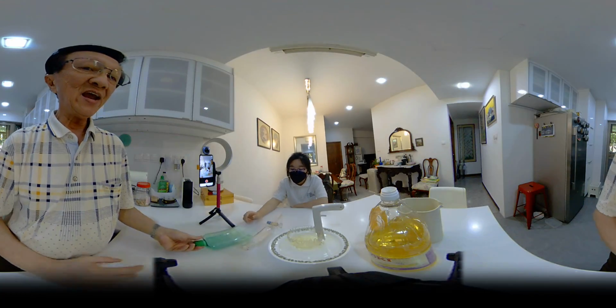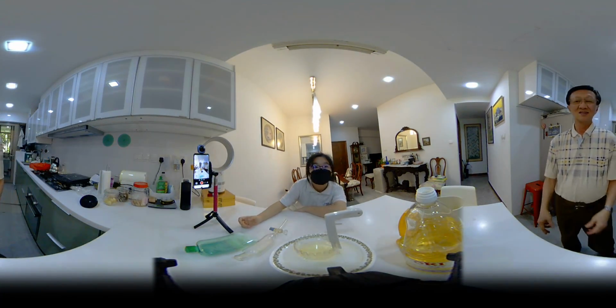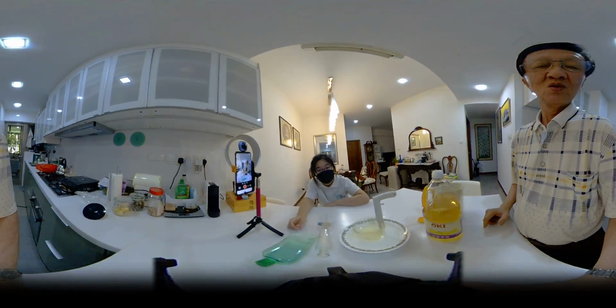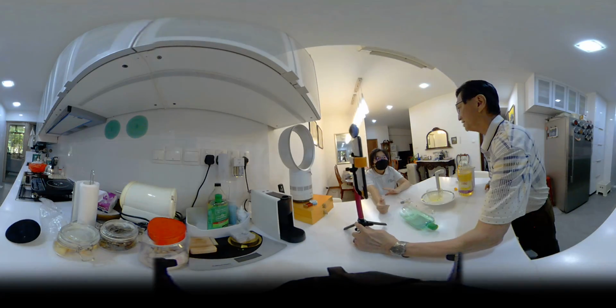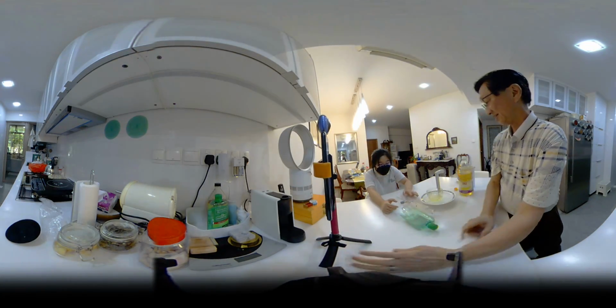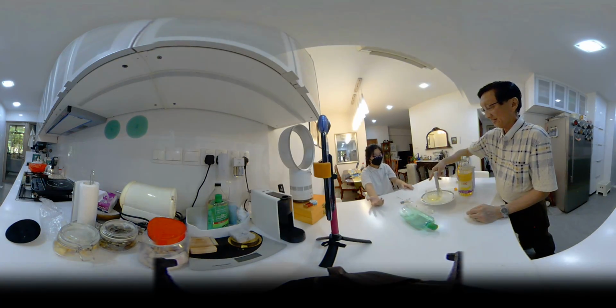Okay. So we have got this. Now we got two directions of this with the same commentary. I think this one has stopped, right? Yeah, stop. They stopped together, I think. Okay. No, not sure, they didn't stop together. Okay, so that's what it is.